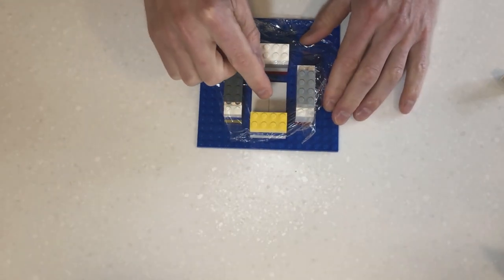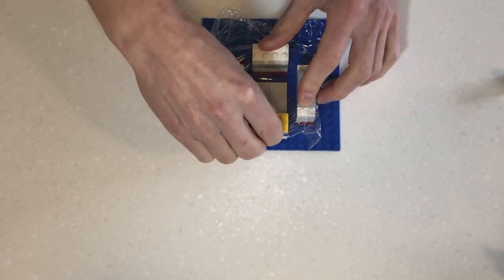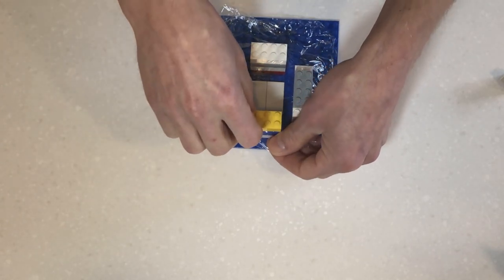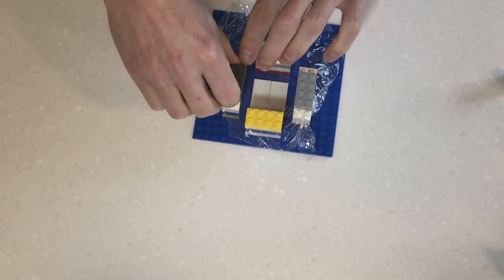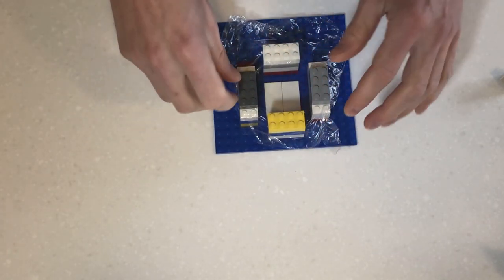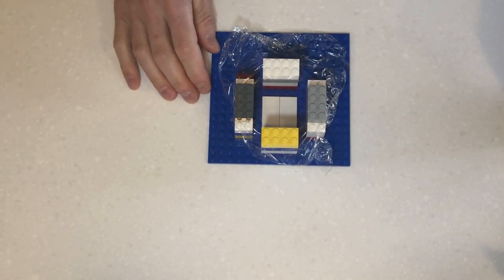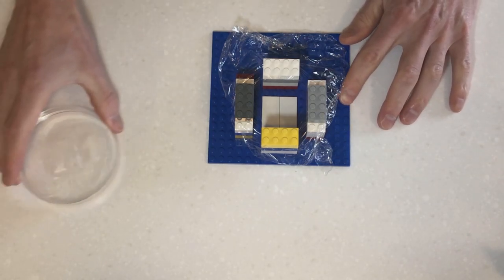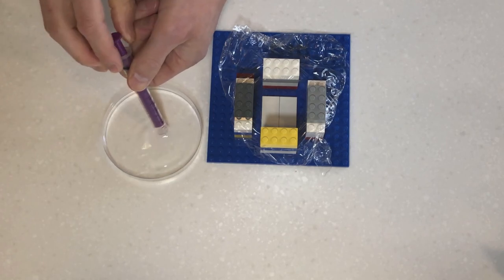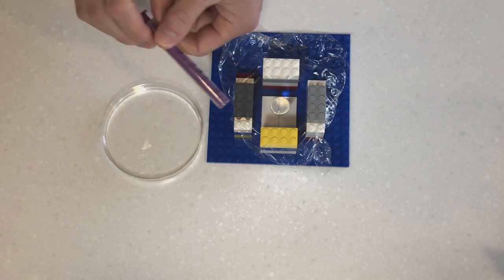Okay, you can see here that there's been some creases in the centre here. We want to try and avoid these. So if this happens, just release one piece of Lego and pull it tighter. Okay, so I've got something like this. There's very few creases in the centre now. So the next thing I want to do is to make our water lens. So I draw a bit of water here, and I place a drop of water in the centre here. Roughly around about that size should be good enough.